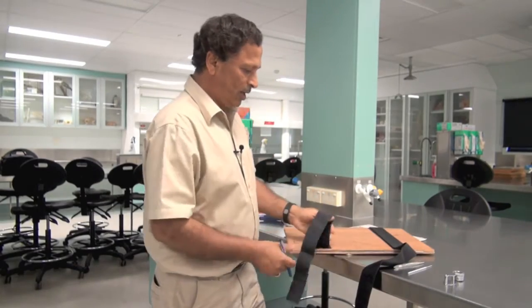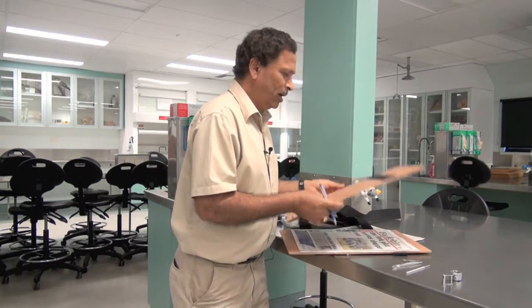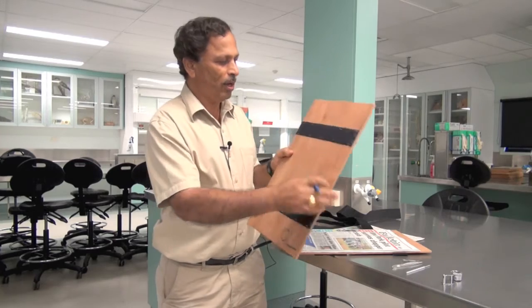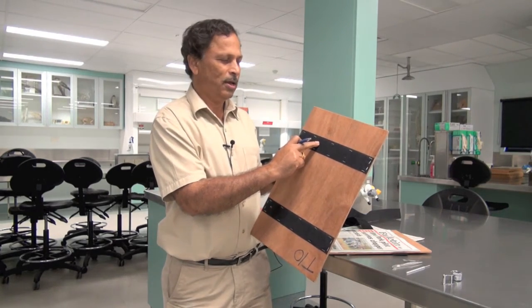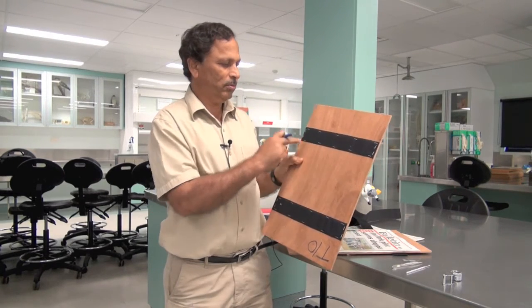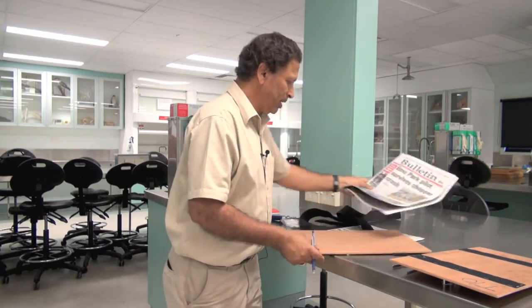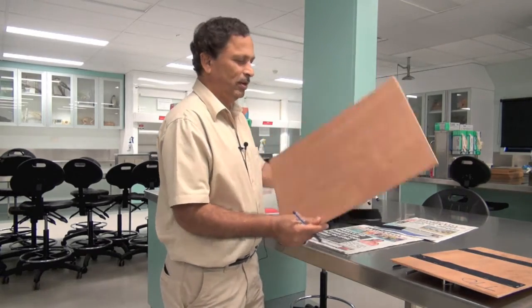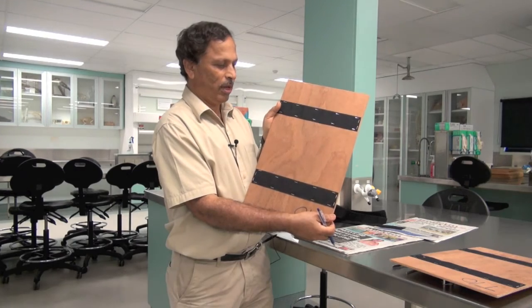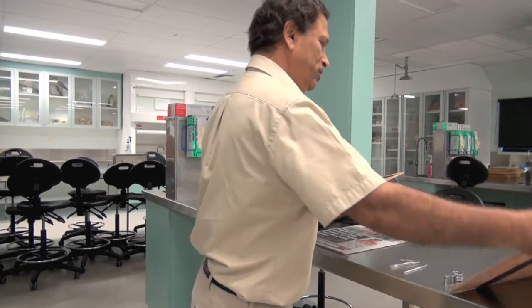What you need to do is get hold of a sheet of plywood, then some male Velcro, and staple the Velcro to the top and bottom with staples. Prepare two boards like that — plywood, Velcro (male on both), and staples.